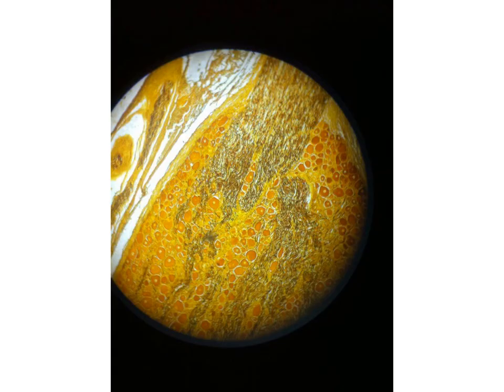This is another slide, also brown color in the low power, so it is one of the characteristic color. It is not the ground compact bone. It is not the nerve trunk stained with osmic acid. It is either the spinal ganglion or the sympathetic ganglion. When we look at the cells, you can see it is a group, a row and a row separated by the nerve fibers, so it is the spinal ganglion stained with silver.